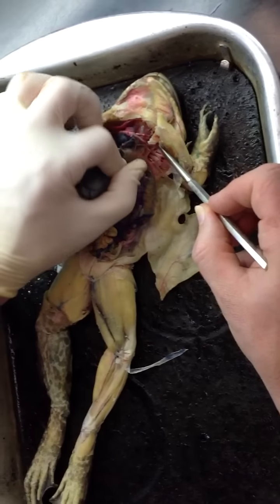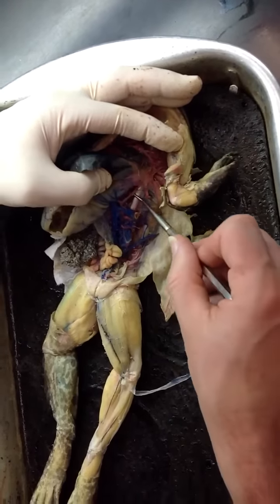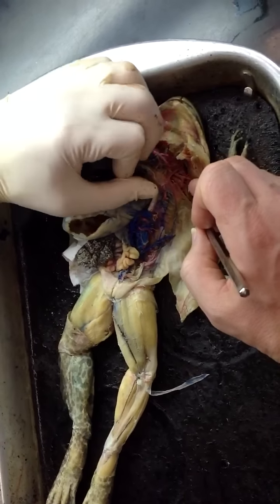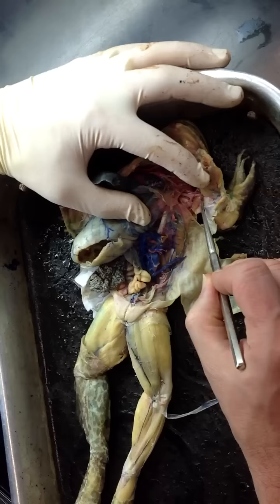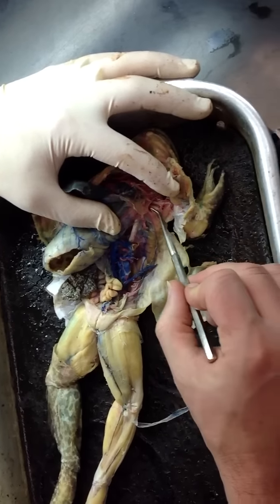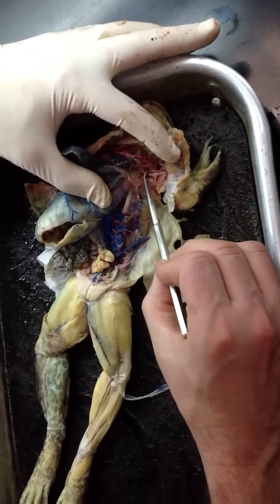Okay, so the last of those three arches is again that systemic arch, which is this one right here, continuing on around this way. A couple of branches that it has include this one, which is the subclavian artery, changing into the brachial artery as it gets into the forelimb. The occipital vertebral artery is not visible in this specimen. It hasn't been cleaned out enough to see it. It would be right in this area, but it's not been cleaned out enough to see it.